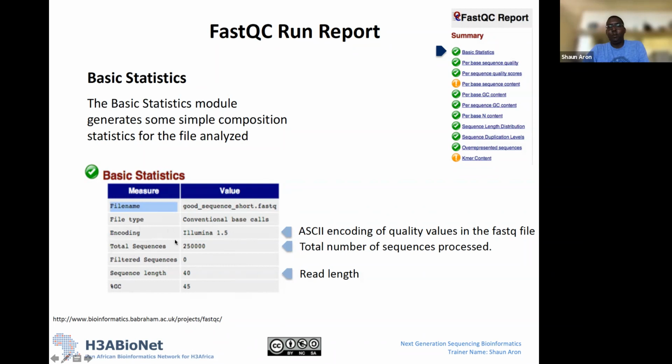It will tell you the total number of sequences in your file. In this file, we had 250,000 sequences. It'll tell you if it filtered any sequences, so if it found any strange sequences that didn't look like proper reads. It will then tell you your sequence length, which would usually be what you're expecting your read length to be. In this particular data set, it's a small read, so it's 40 base pairs. Again, this depends on what experiment you're running, whether you expect 150 base pairs or 100 base pairs. And then it tells you the percentage GC, which is 45.